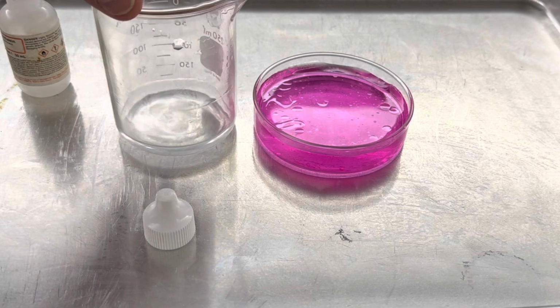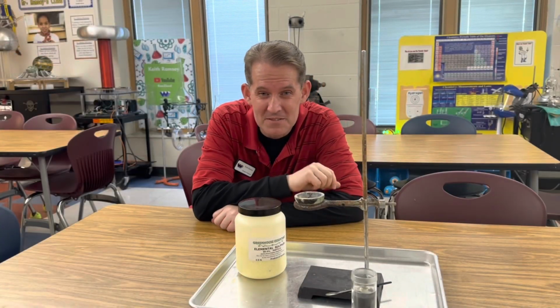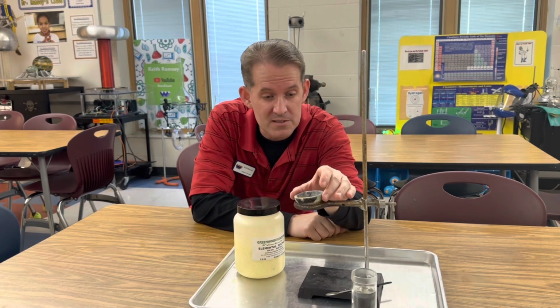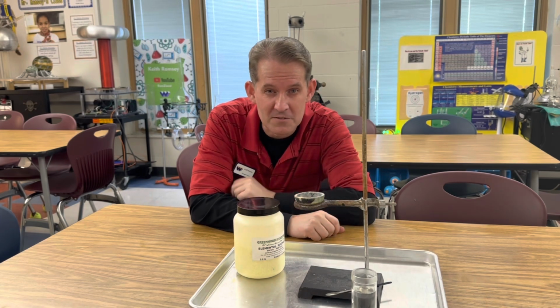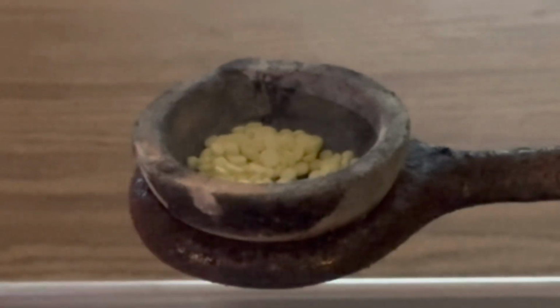Evidence of cesium hydroxide. And at last, I'd like to synthesize just a little bit of cesium sulfide. We're going to take some sulfur and we'll melt it into this ceramic crucible, and then we'll add a very small amount of cesium. Check it out. Okay, now we're ready to start heating it up.